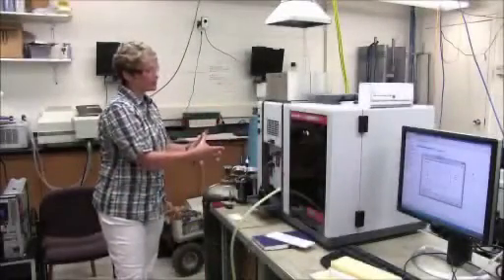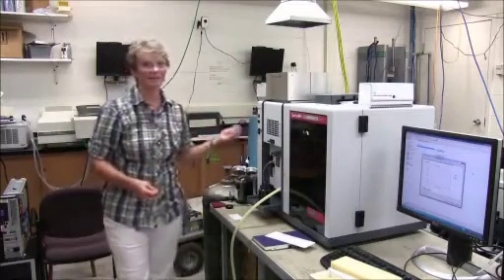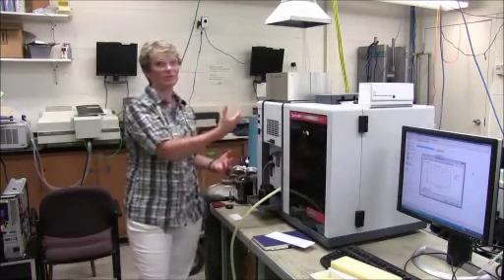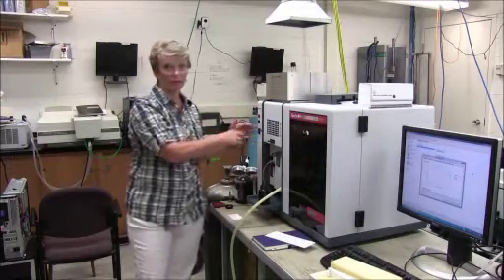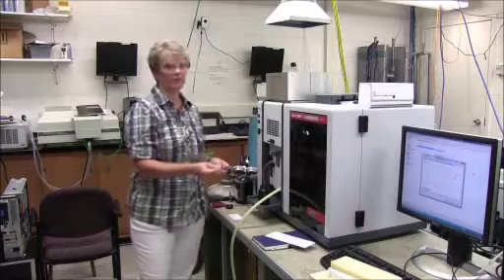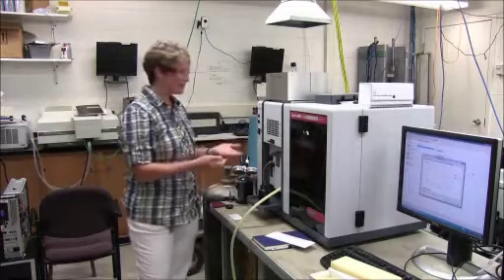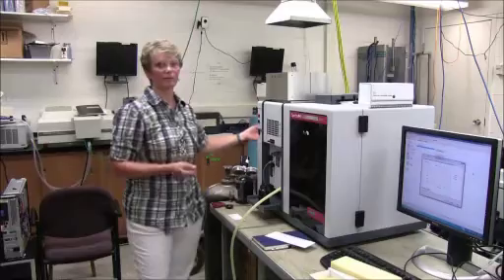The atomic absorption spectrophotometer then is looking for actually the atoms in a gaseous phase. So these aren't compounds. You're actually aspirating a sample up, and the atoms are going into a gas phase and then being excited in that burner. And as a wavelength of light specific for that metal is going through, it's absorbing as it excites and then falls back down to a stable state. And that's what the detector is picking up, is that absorbance.